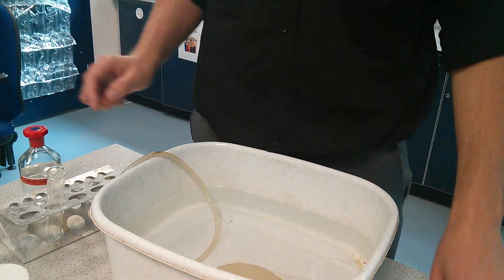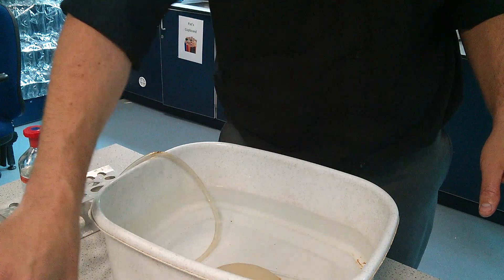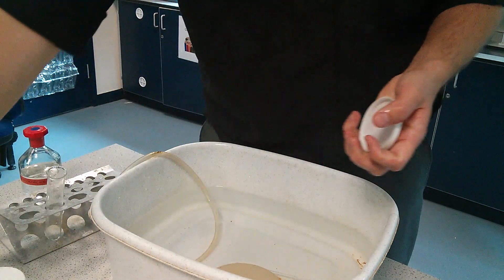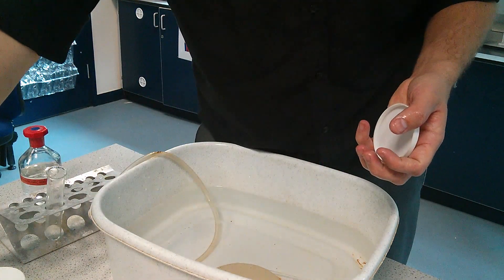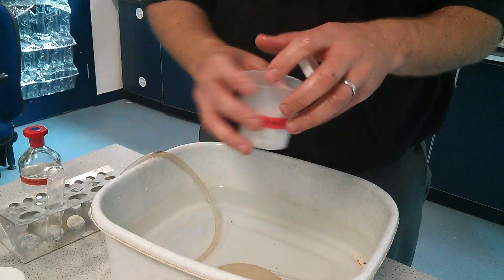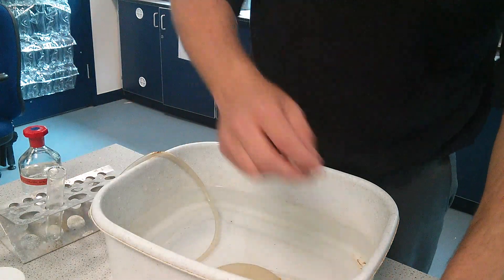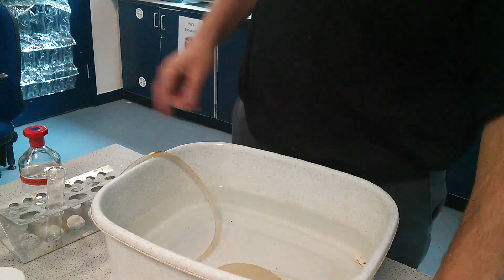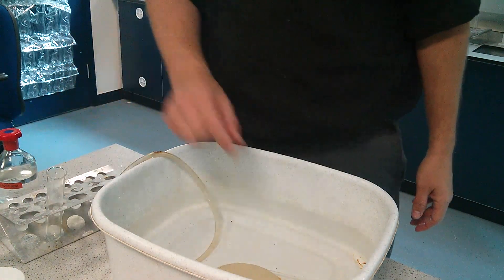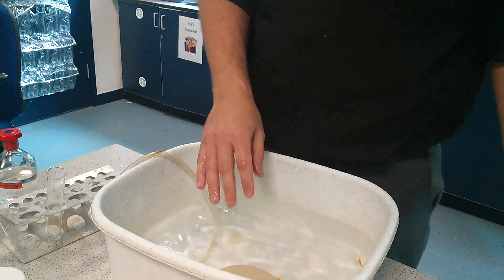First, you need to get a pot to get your limestone. Start off with large — go to the scales and measure two grams of limestone, or as near to two grams as you can get. Someone can measure 30 millilitres of acid and someone can fill the test tube up with water.